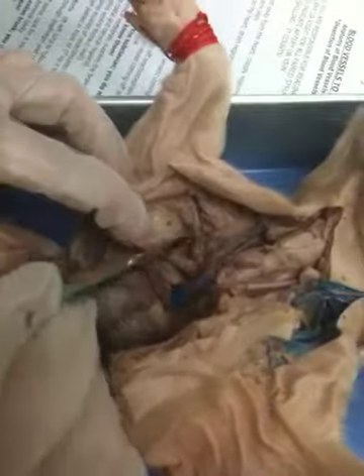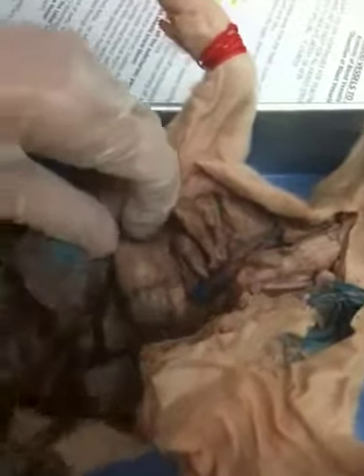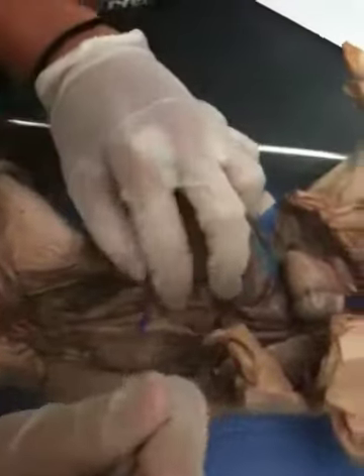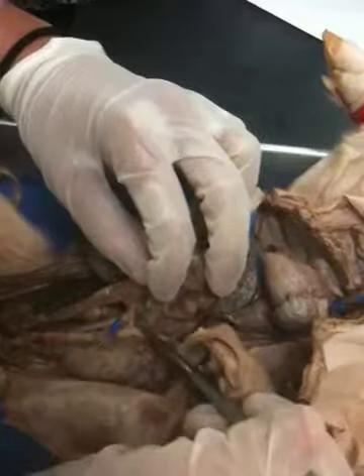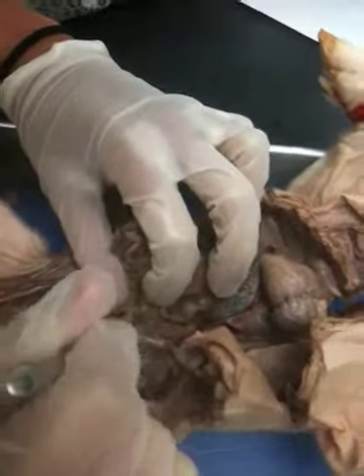Then the left axillary. And we go into the descending aorta, just down here. The white tube, the descending aorta. Then we move down to the celiac trunk, which is the first thing that comes off the descending aorta. Then we have the superior mesenteric artery. It's the second one that comes off the descending aorta.